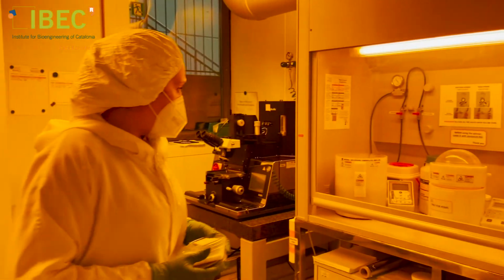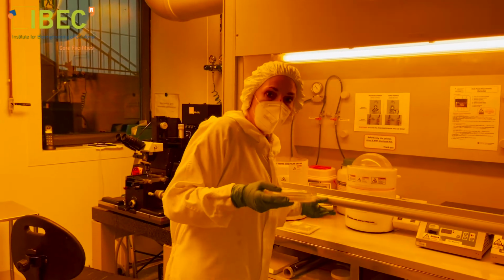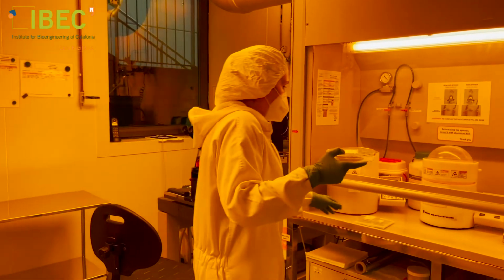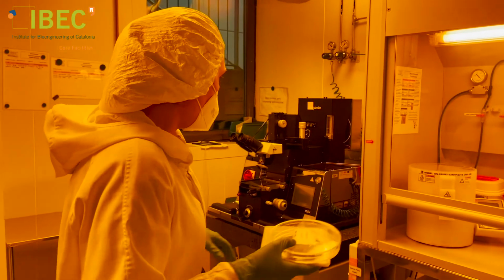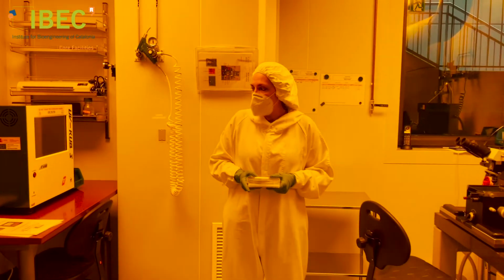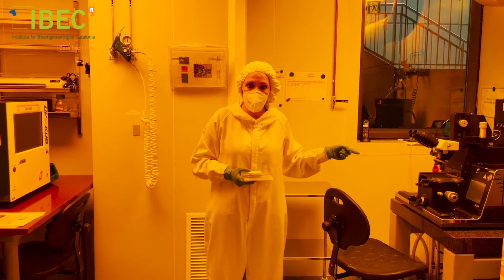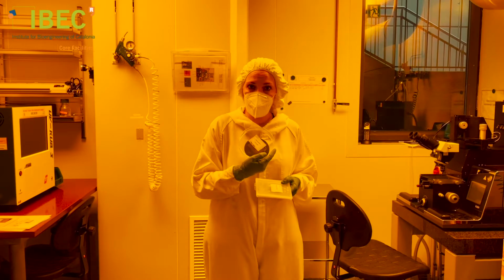And once we have deposited a uniform layer of photoresist on one substrate, like this silicon wafer, we take this substrate and the mask, and we use them together in this or these machines. These are mask aligners, and in this case, this is a mercury lamp that shines on this mask and transfers the pattern to one of these wafers.